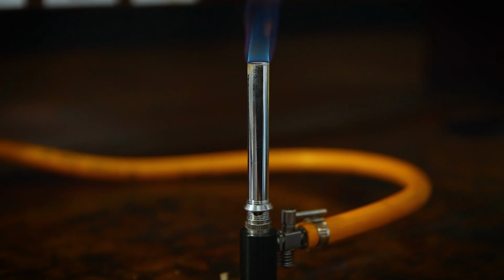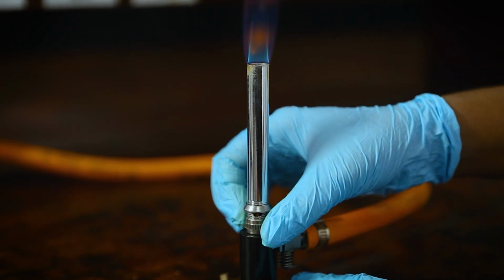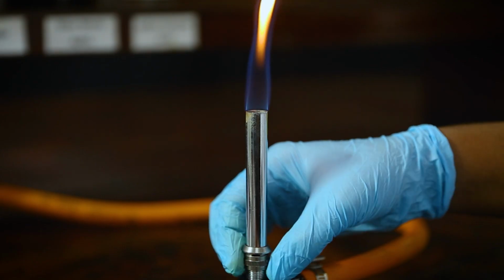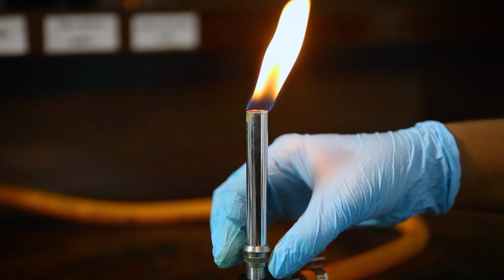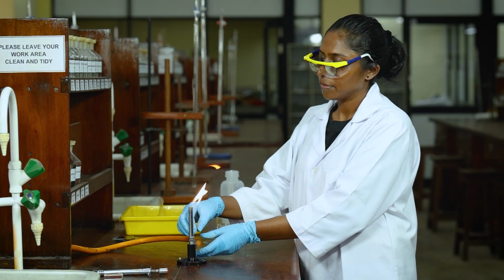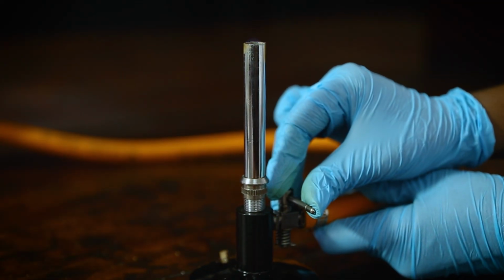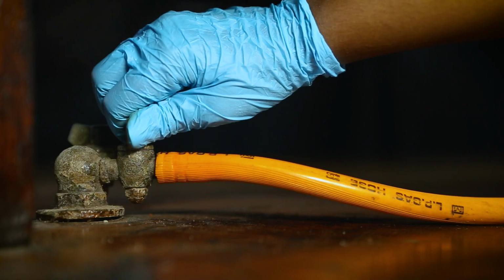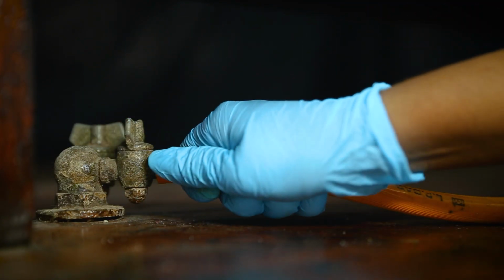The fifth step is to turn the Bunsen burner off. For you to safely turn off a Bunsen burner, first return it to the safety flame, or yellow flame, by closing the air intake from the barrel. Next, turn off the gas valve on the Bunsen burner itself. Turn the gas tap off. Finally, disconnect the hose from the gas tap. You have completed your experiment.